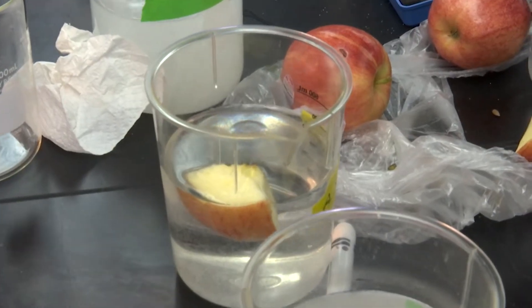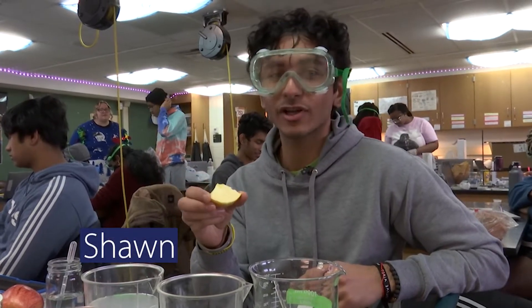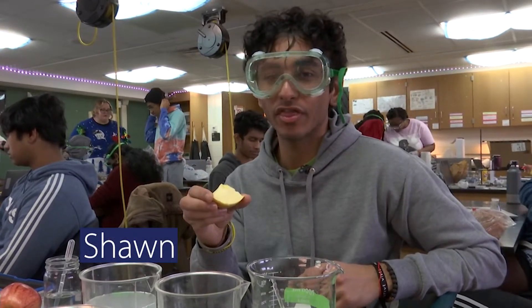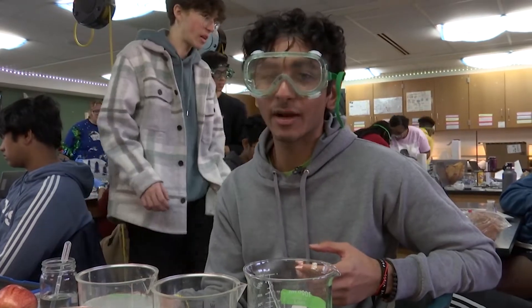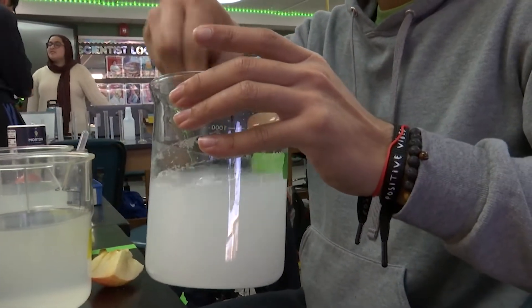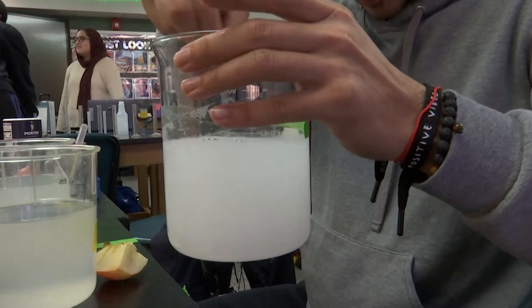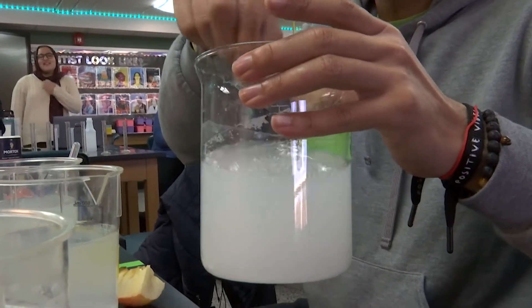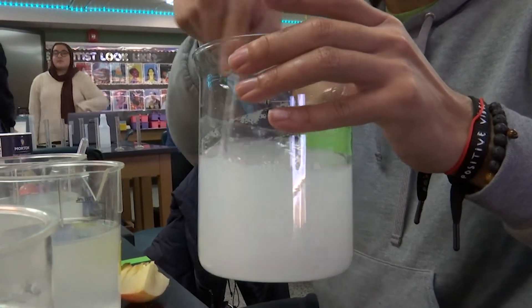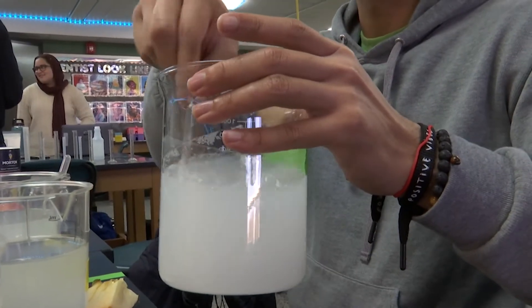I'm measuring the sucrose concentration of apples, which is directly correlated with the preservation of the apples itself, and I'm trying to see how salt in a solution can help preserve apples over time. This one has 215 grams of salt, so it takes a while to work through all of it.